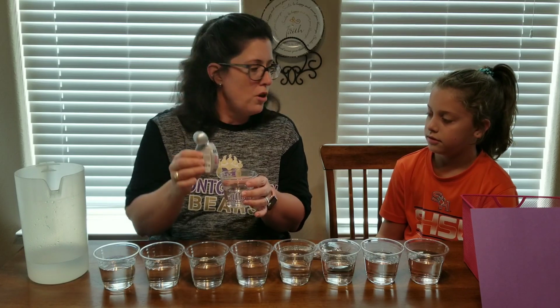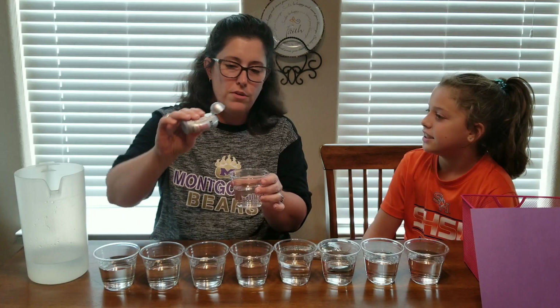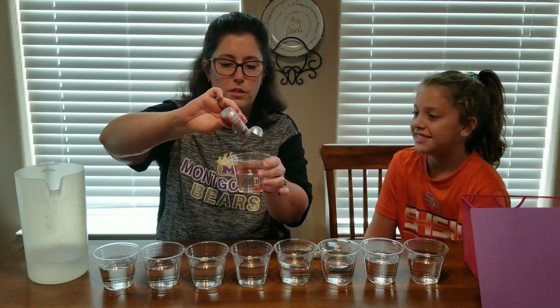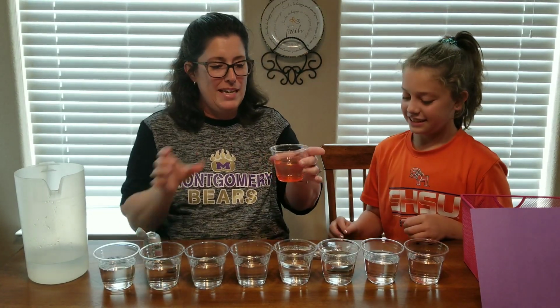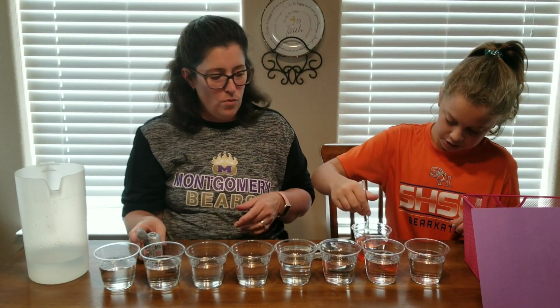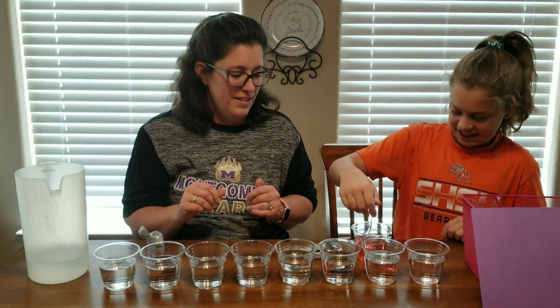So, how many drops do you think I should do? Probably 2 or 3. 2 or 3? All right. I'll start with 2. Oh, a whole bunch just squirted out. So there we go. We got plenty in there. So Carly is going to stir for me. And then hopefully it will stay off the side. Yeah, I got a little bit on my hand. It's all right. It's already dissolving.